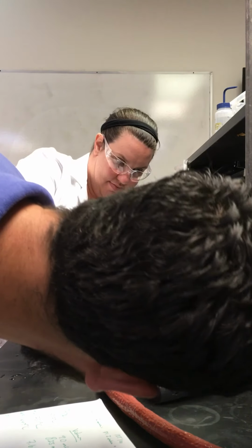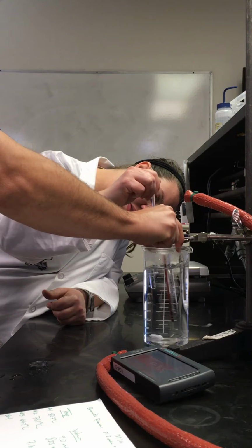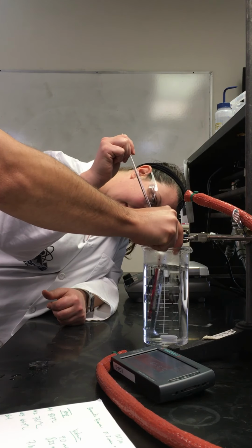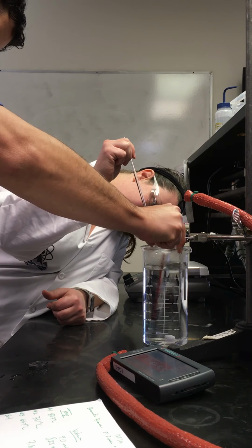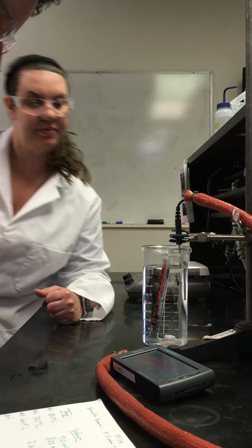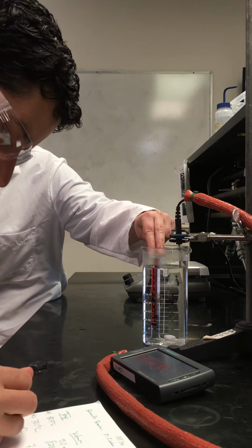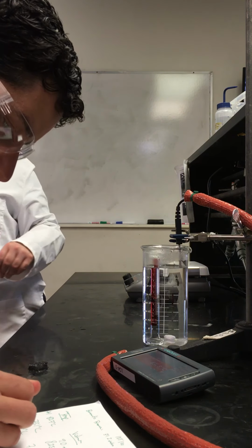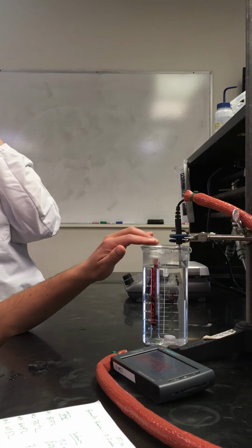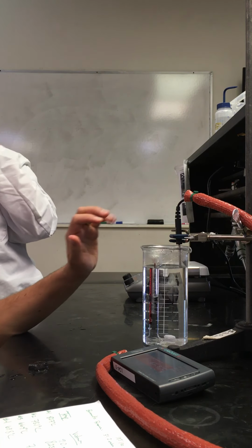Is there still an ice cube floating around in there? Or is it... that's the ice cube right there. I think it's gone now. Yeah, I believe the ice cube has been melted. So next one, 63.4 or 63.8 degrees C, and this is 7.123.